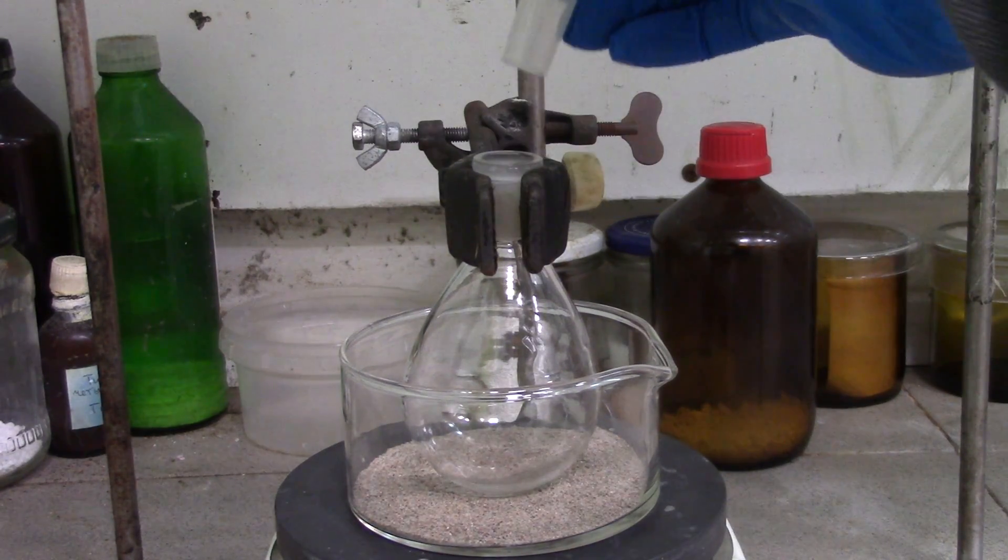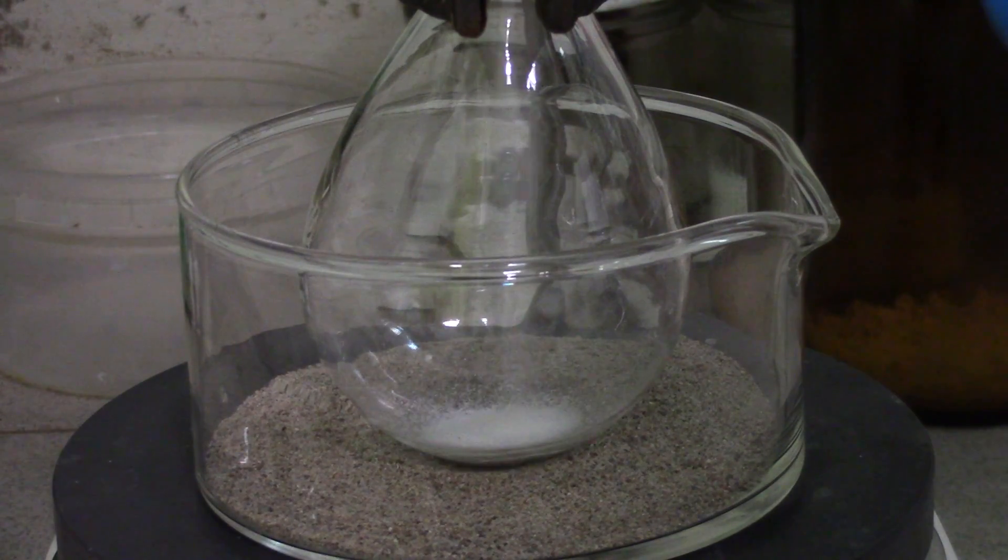Further, I put the whole stuff into a 100ml flask and put it onto a sand bath.